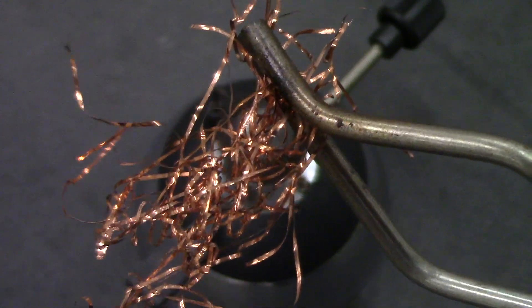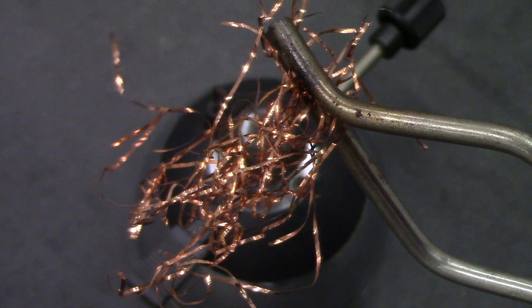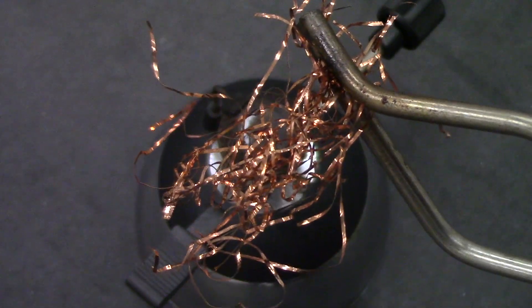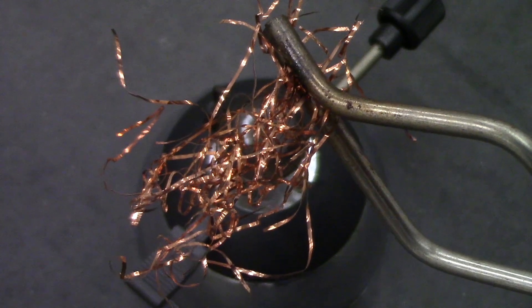I have here some copper wool, and looking at it we can see the very shiny, familiar brown-orange color of copper.